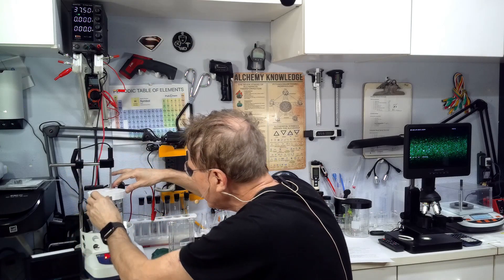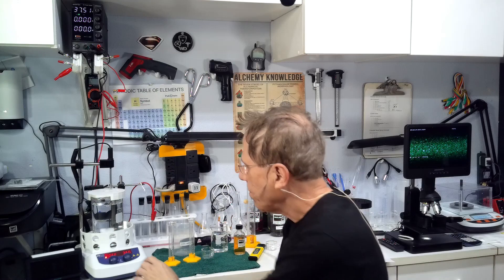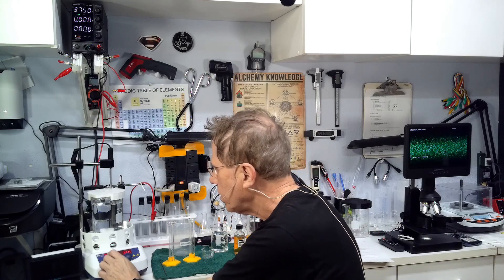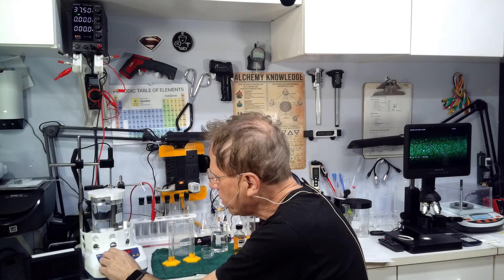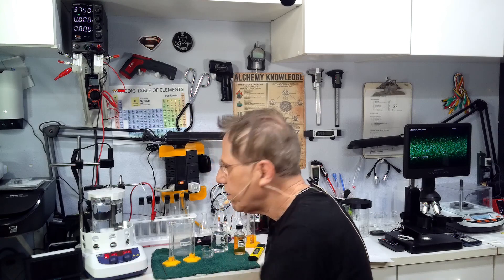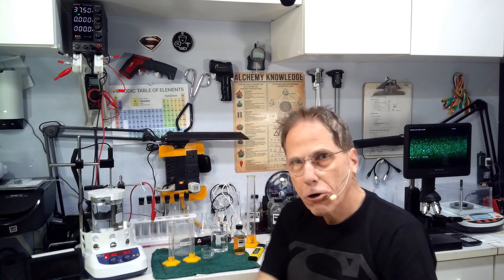We want to preheat this thing to 80 degrees Celsius. The whole thing needs to sit at over 70 degrees C. I'm going to dial in this temperature thing here.